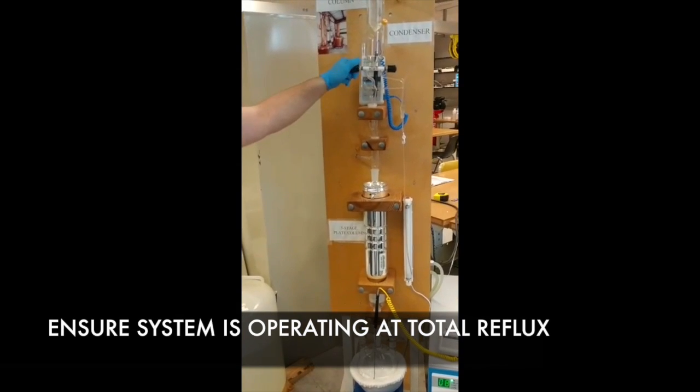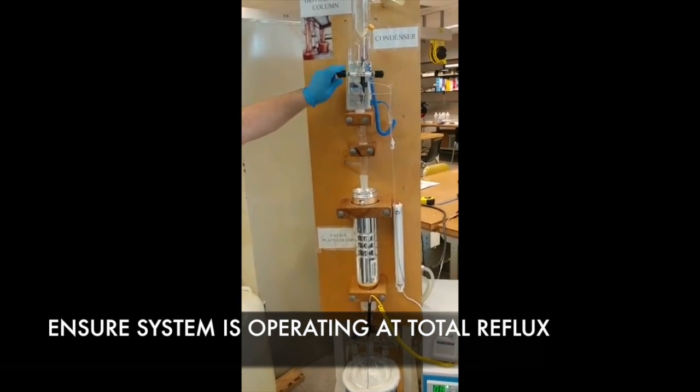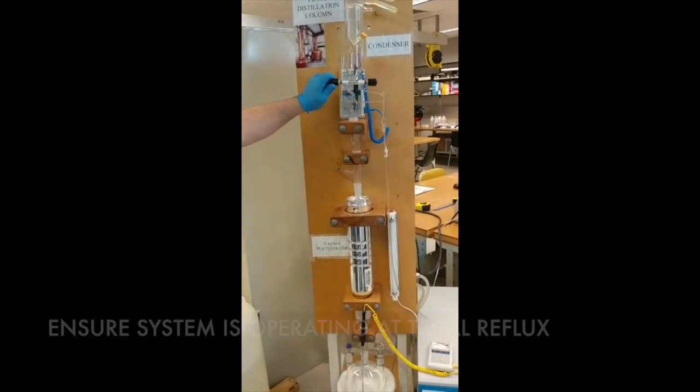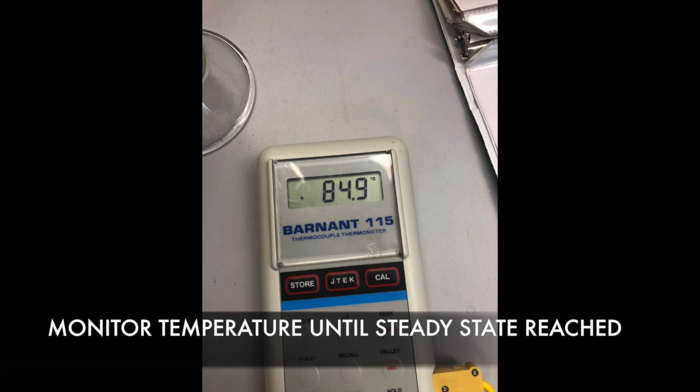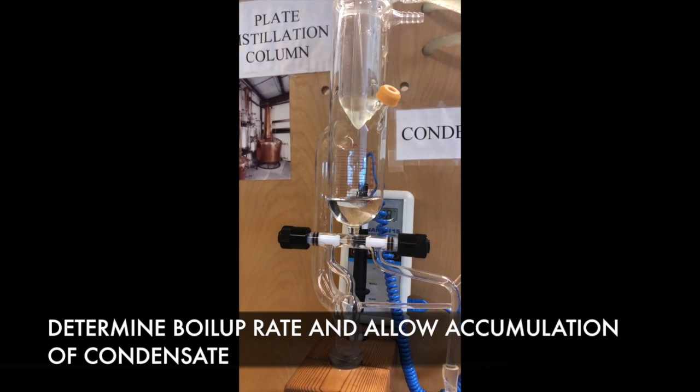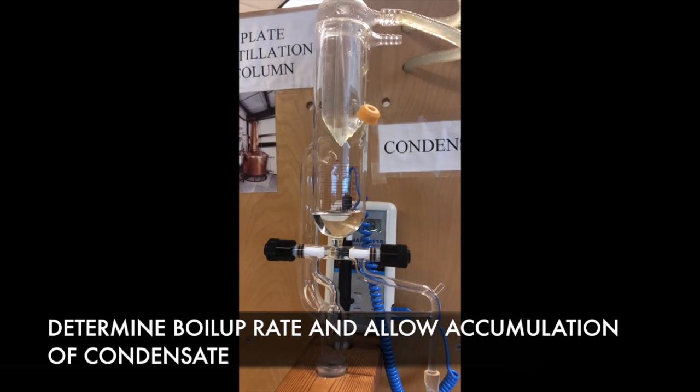The column is operating at total reflux, meaning that the vapor can move up and liquid can move back down freely in the column. Monitoring the temperature, we will allow the system to reach steady state by recording the temperatures at the top and bottom of the column every 2 minutes until we no longer see a significant difference in readings. Once we reach steady state, we will take a sample at the top as well as the bottom so they can be analyzed using the refractometer. After 10 minutes, we will do this again to confirm that the composition has not changed.